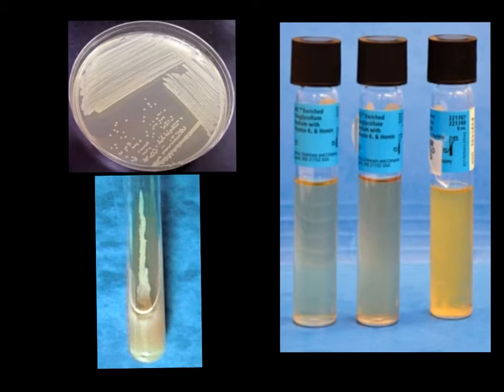The exact procedure for heat fixing bacteria depends upon whether the bacteria is coming from a colony from a petri dish or agar slant, or is the bacteria coming from a liquid broth type situation such as we see in these test tubes.